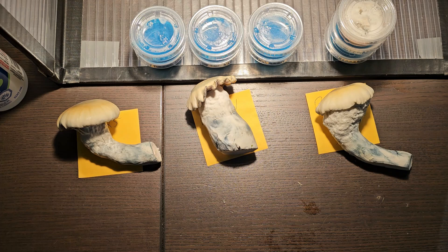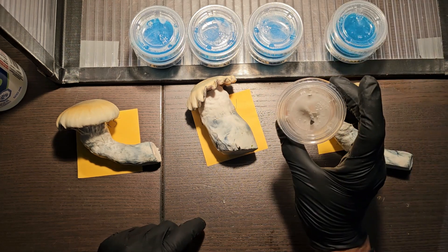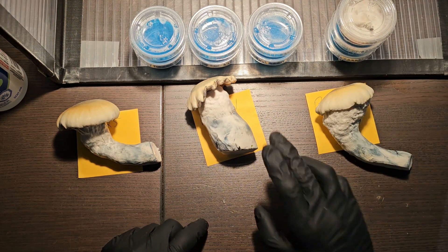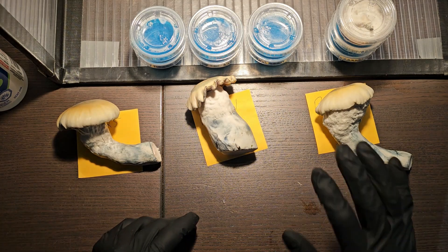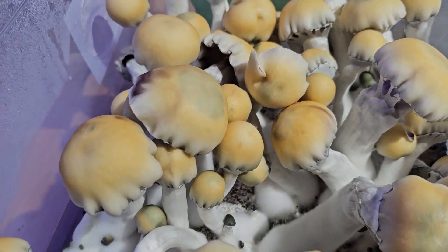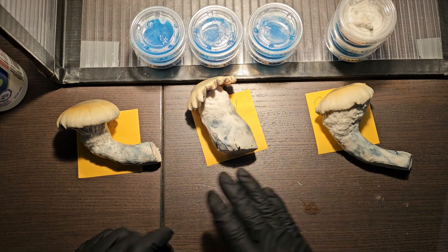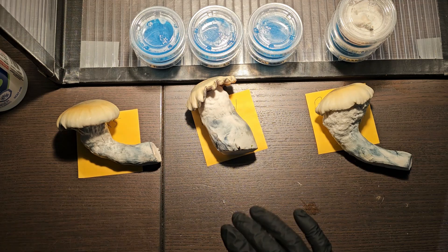Anyway, I'll talk about all that in some future videos. Today is just a quick video — I'm going to do some clones. I've got one cup that I've left lying around long enough for it to grow a mushroom inside, which I'm going to transfer into some fresh agar. I'm also going to do two cups for each of these mushrooms as clones. I've been growing this strain for a while and just had four tubs come in larger and fuller than ever from cloning it multiple times, trying to get some really strong genetics. I've picked out three different styles of mushrooms from the same batch — each one from a different tub.